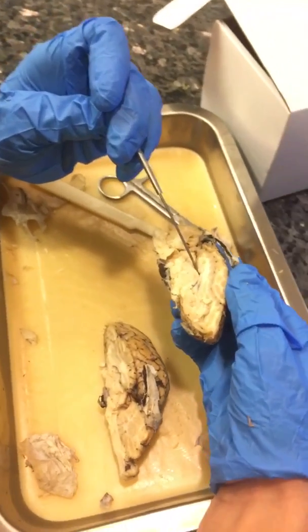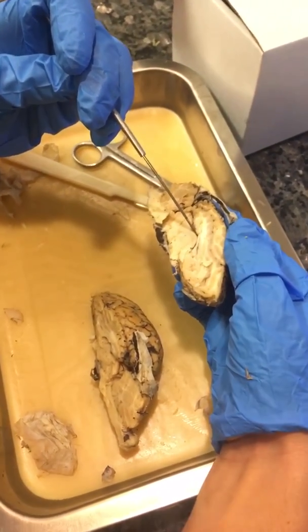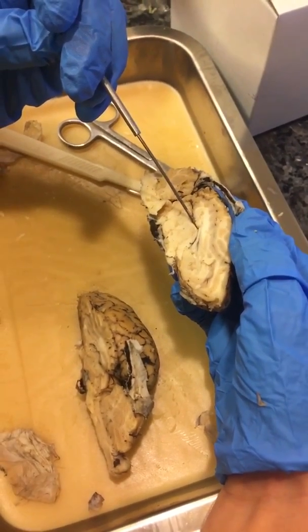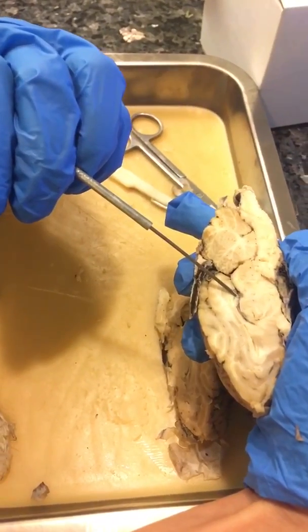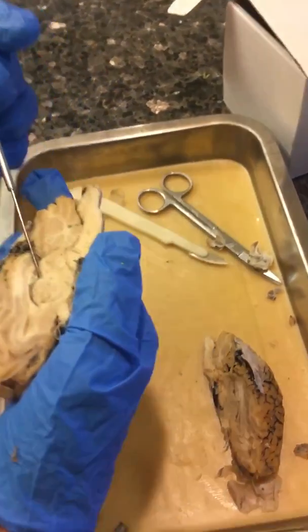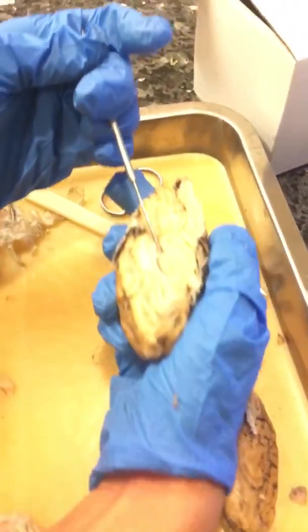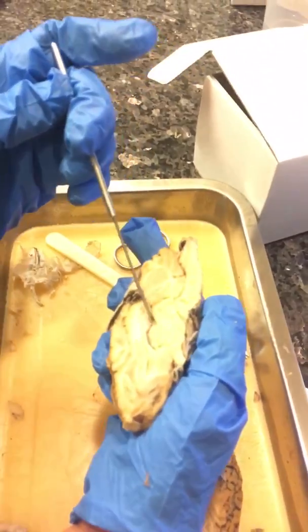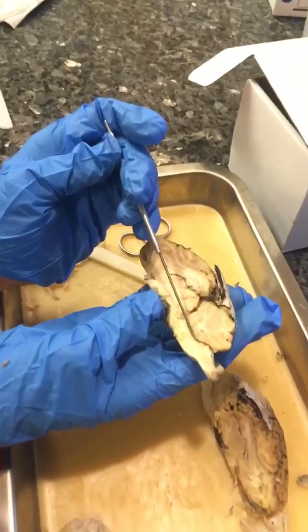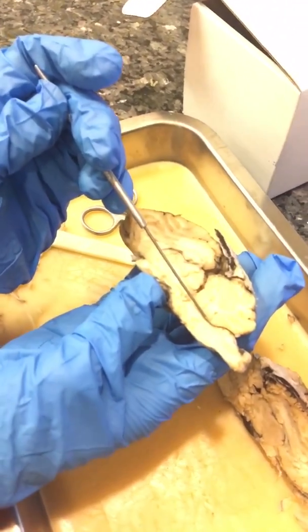The third ventricle is also a structure that's a little hard to see, but I think it would be in this region — it's hard to tell on this particular sheep brain. Continuing on in the midsagittal section, you can see the cerebral aqueduct. And here in the midsagittal section, you can see the fourth ventricle.